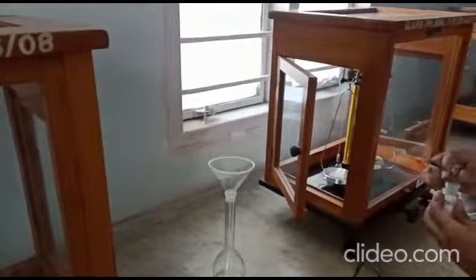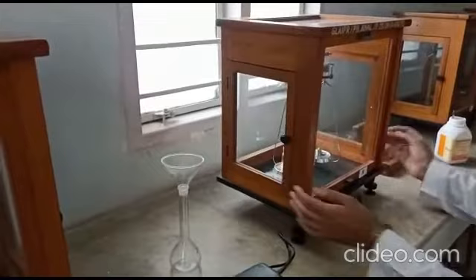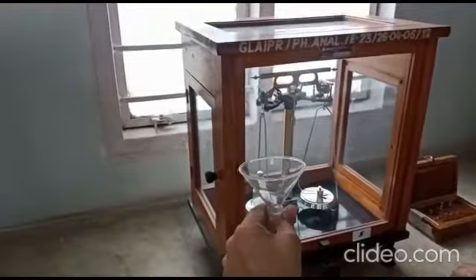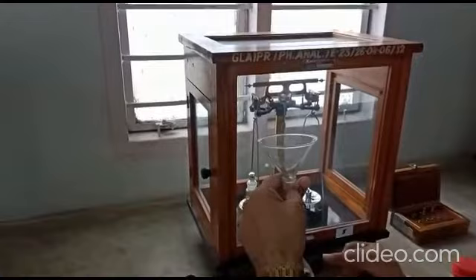We weigh the bottle again after transfer — we take two readings: one before transfer and one after transfer. The difference gives the exact weight of oxalic acid transferred. For example, we have taken approximately 0.6-something grams. We will check the exact reading in the lab, then dissolve it with distilled water and make the volume up to 100 ml.